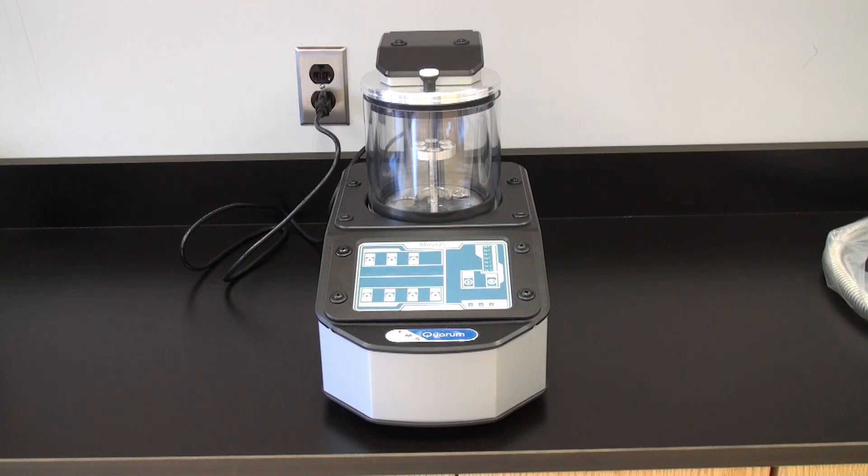So what I'd like to do today is show you the instrument in a little bit more detail and show you how to set it up and get it into operation.